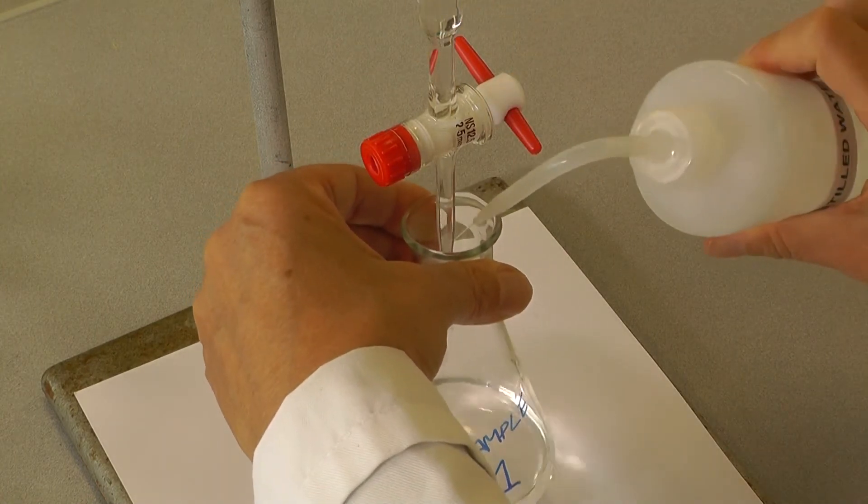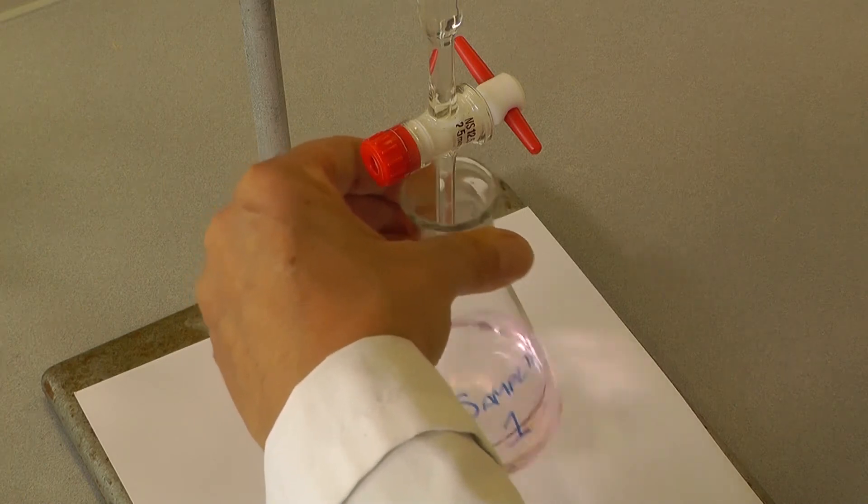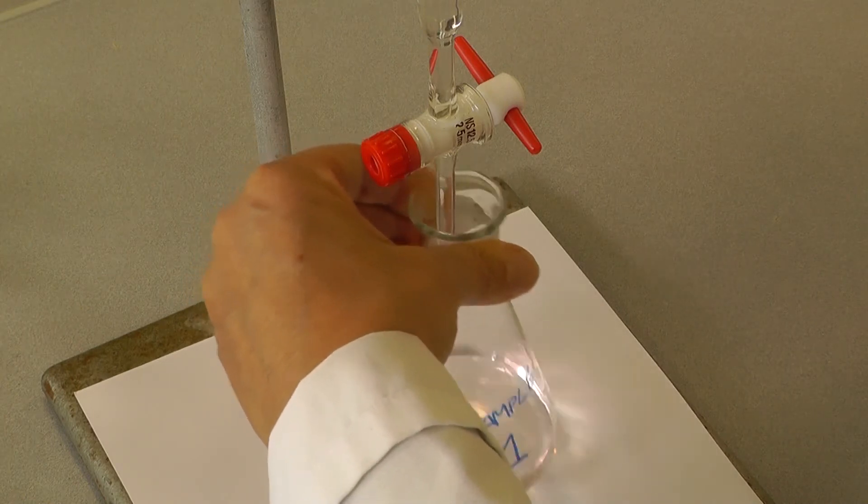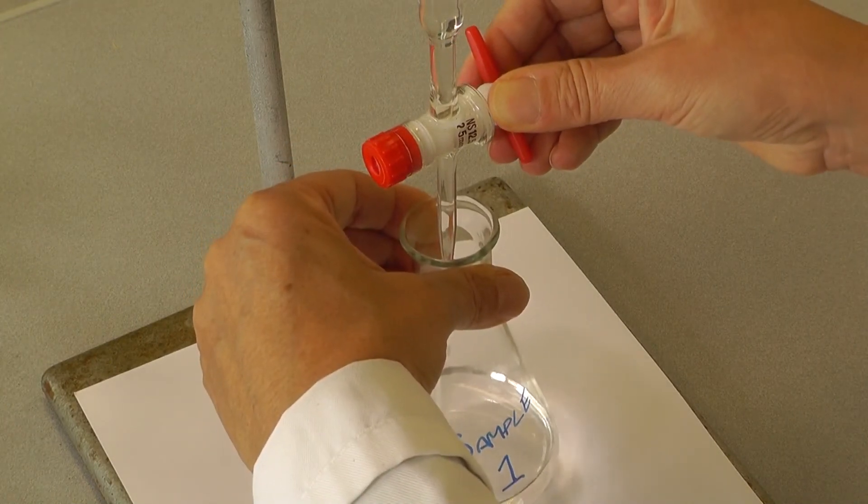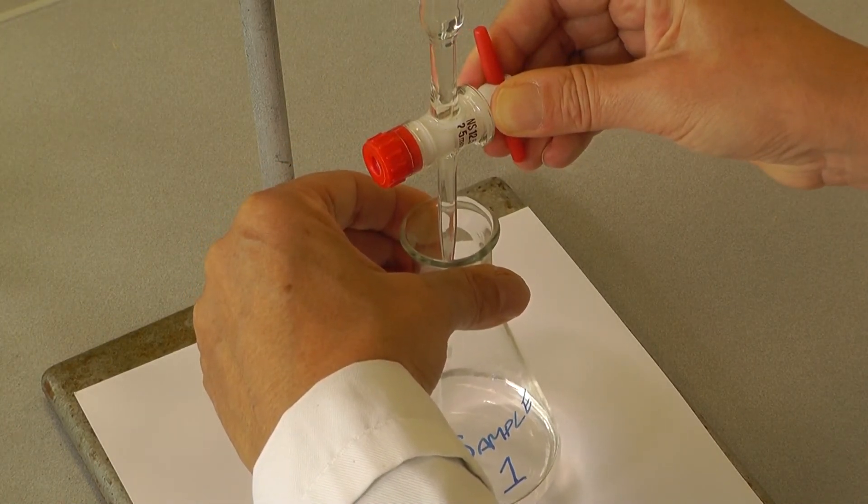It is a good idea to rinse the tip of the burette and inside of the flask with distilled water to ensure that all titrated solution has been added to the reaction mixture. During this step, the flask should be shaken more vigorously.